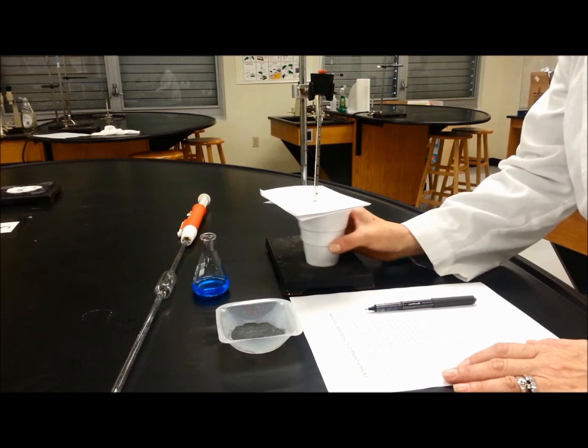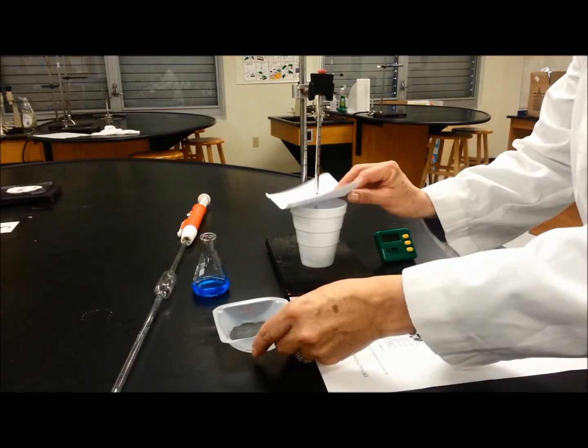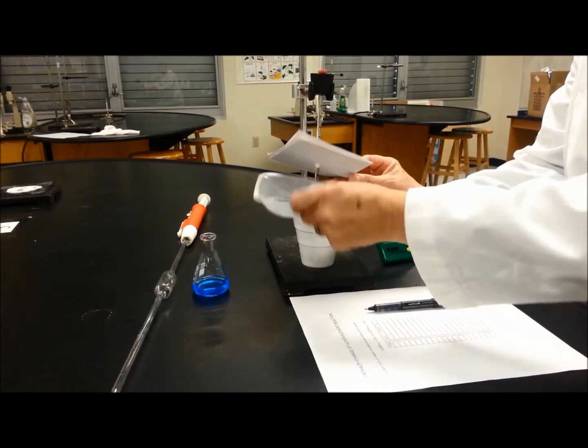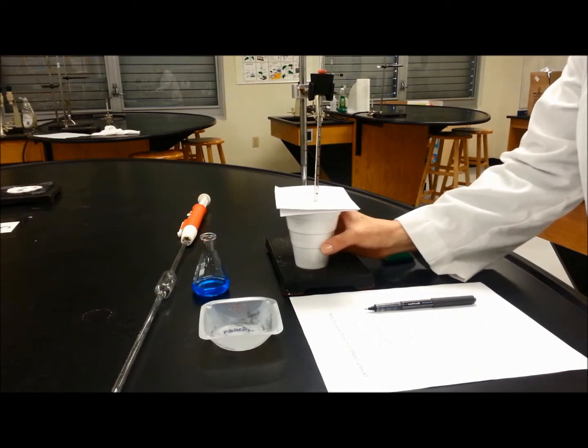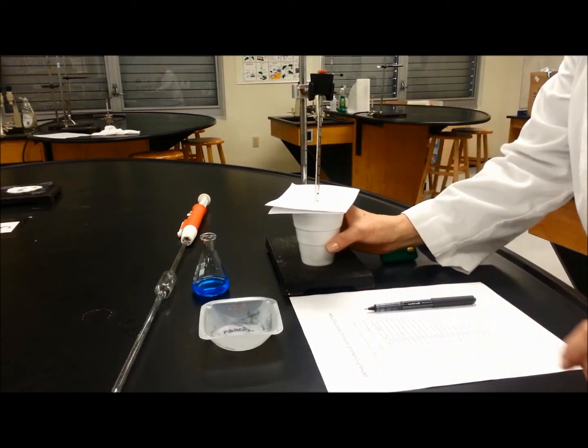When the time gets to exactly three minutes, you are going to open the lid, put all the zinc at the same time and continue swirling and begin looking at the temperature rise.